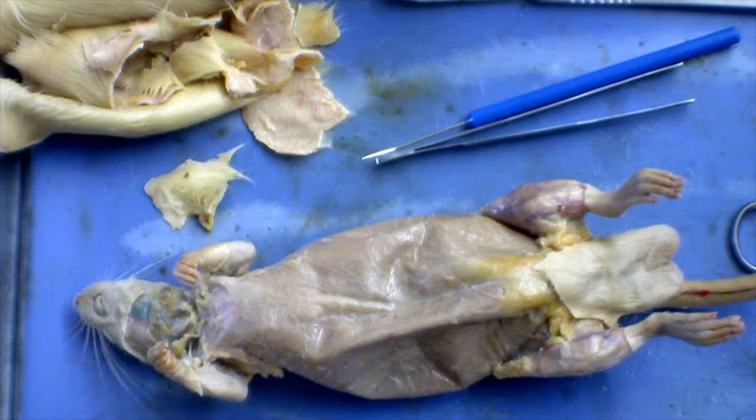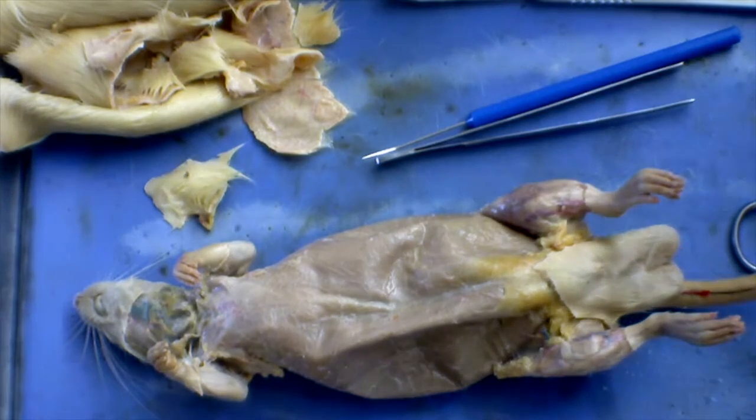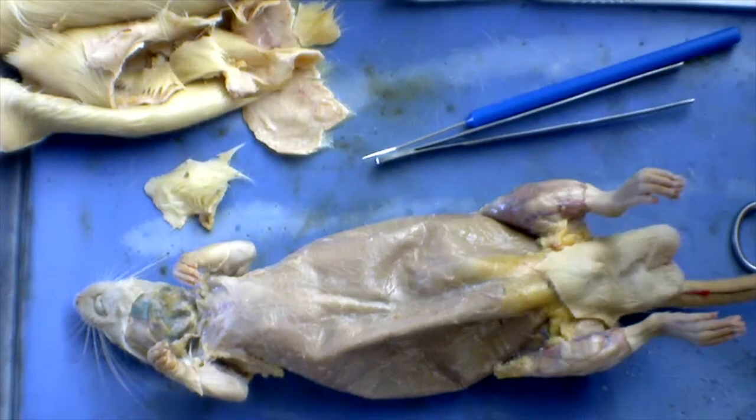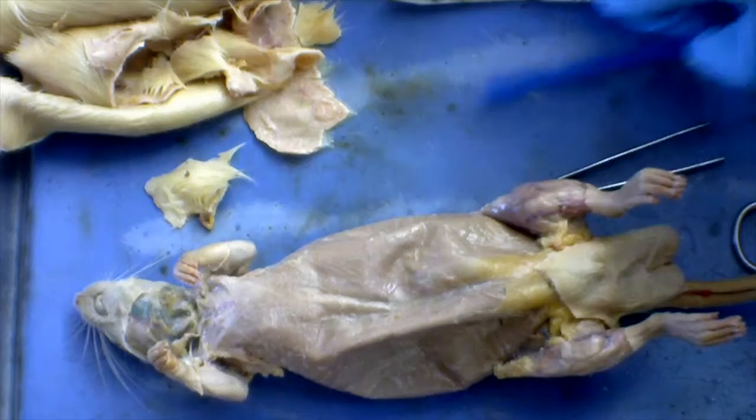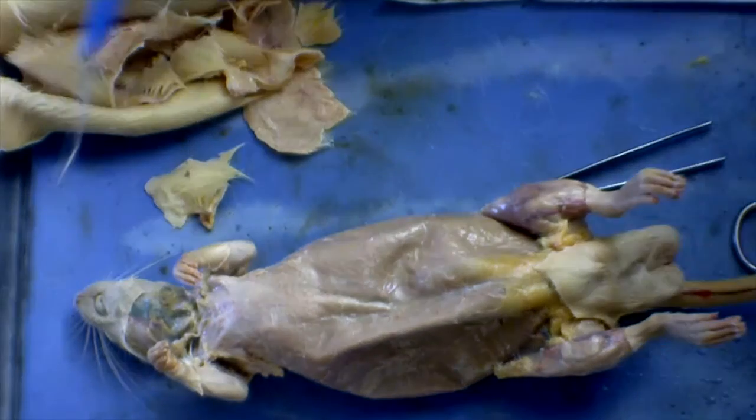This video is going to give a quick overview of all of the superficial muscles that are located on a rat. This includes the muscles on the head, body, and tail end or back end of the rat, and legs and arms. So basically, we're going to start by looking at the rat from a ventral view and identifying the muscles underneath.